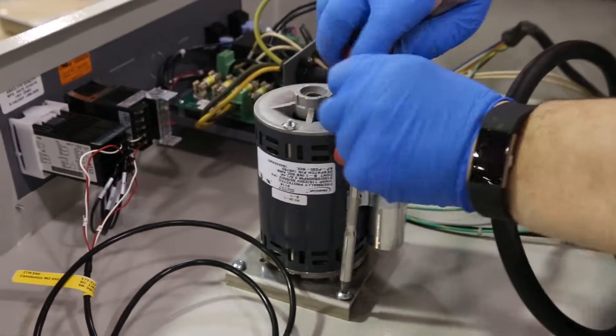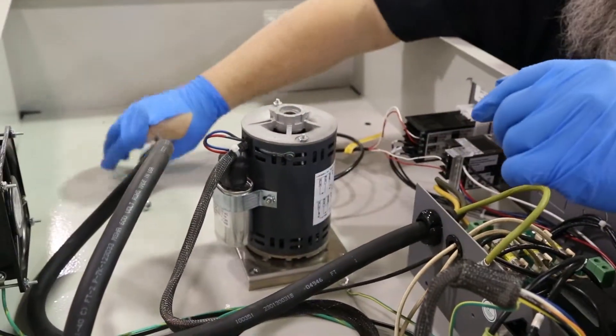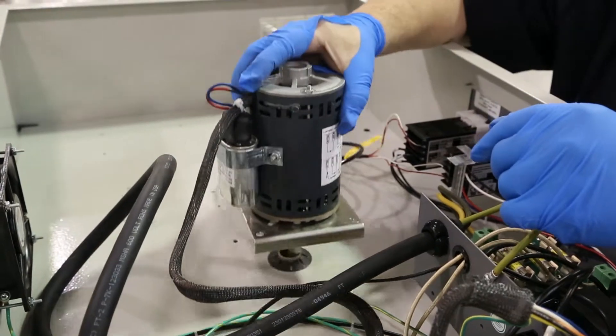Remove the four motor mounts with a T30 driver. Then remove the motor and stand on end.